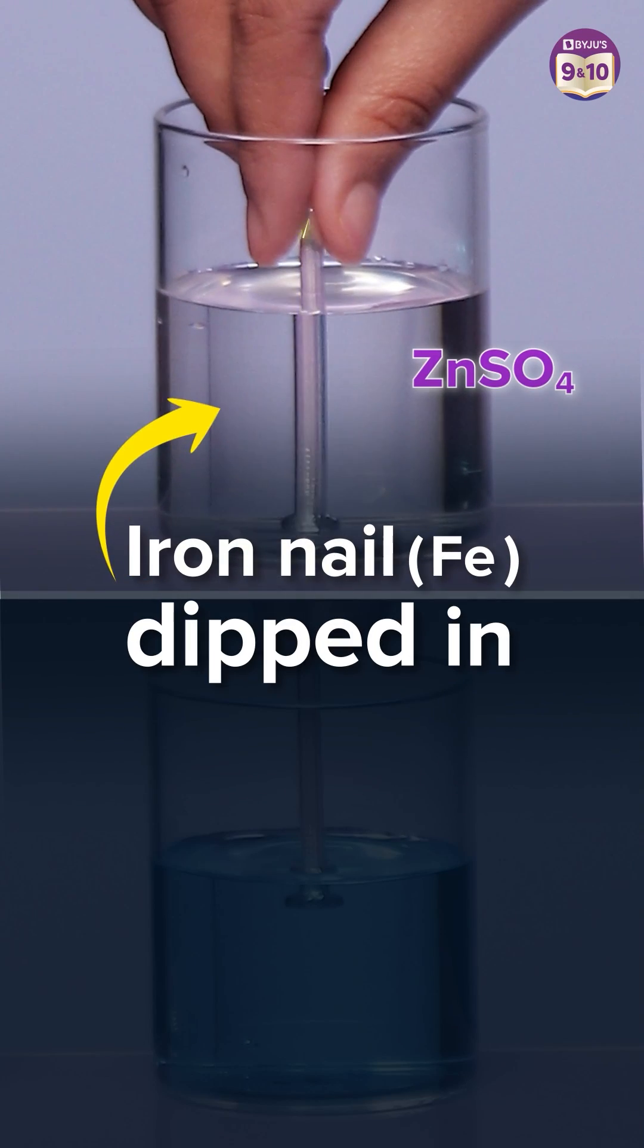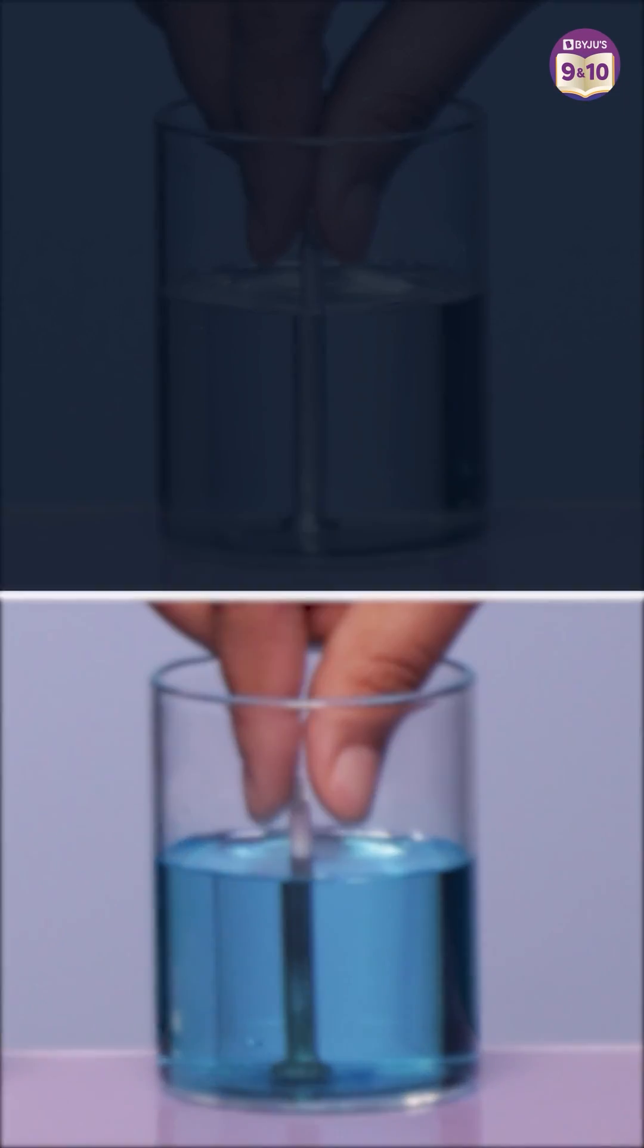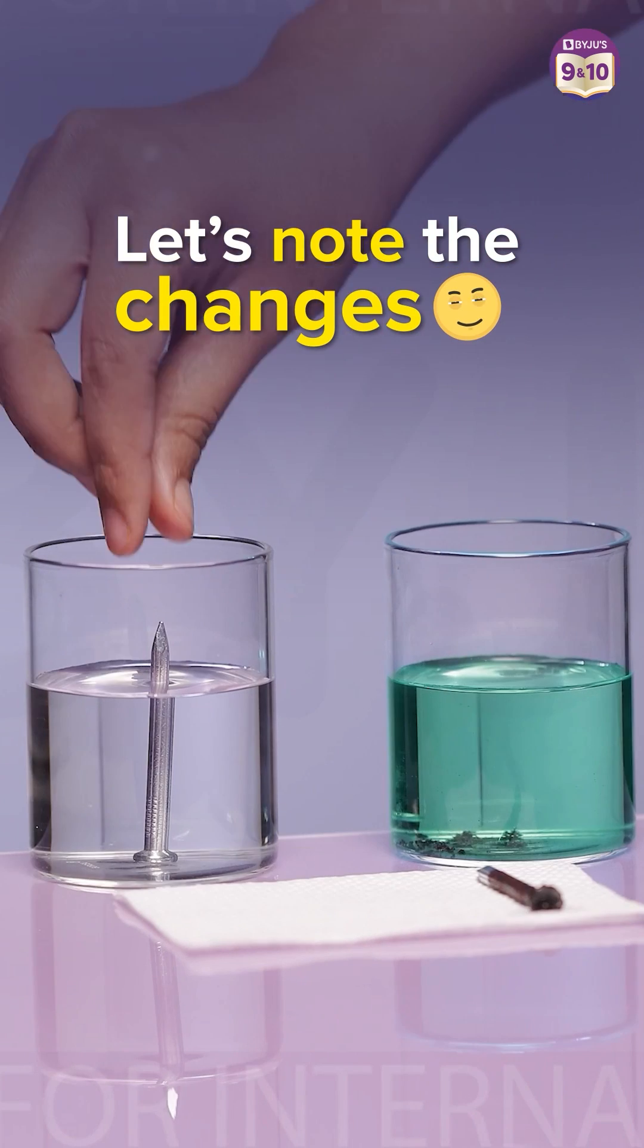Next, we took two shiny iron nails and dipped them in each solution. Let's look at what happened to the nails after 20 minutes.